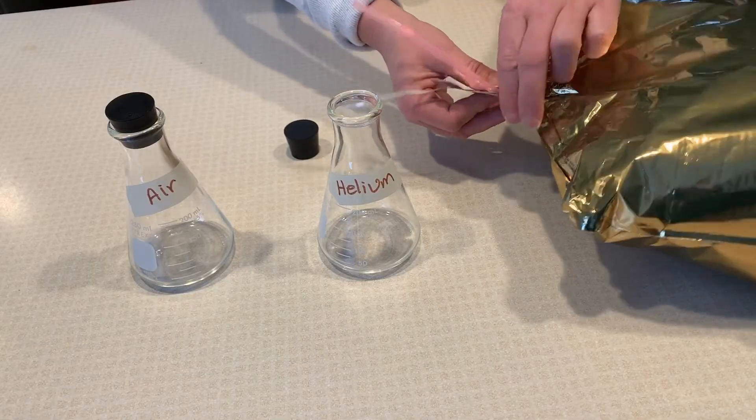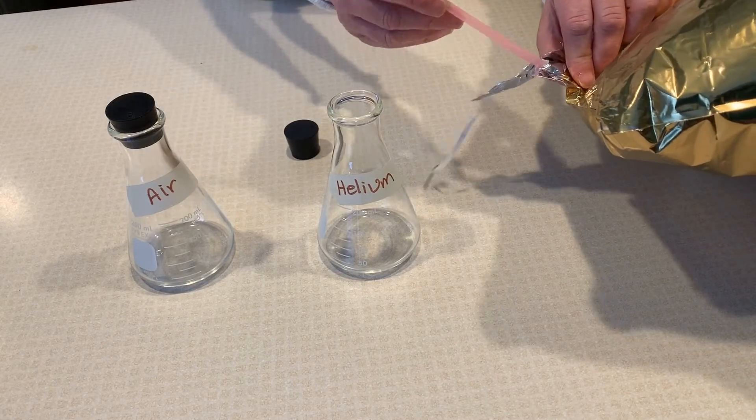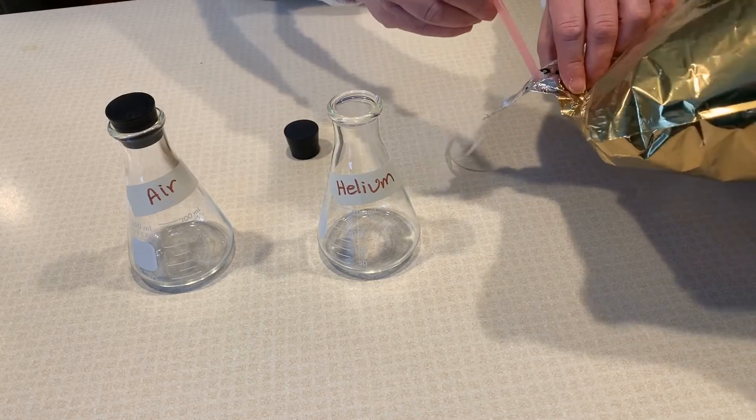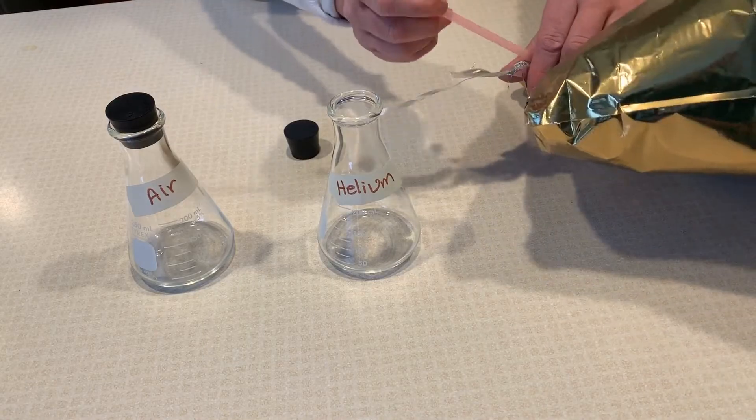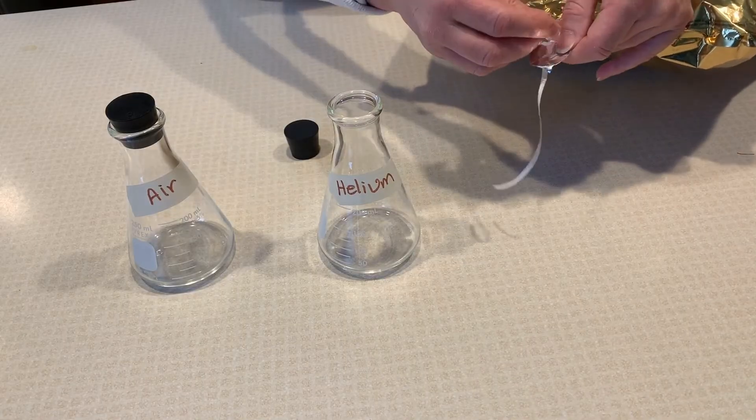In order to get the helium from inside the balloon to my flask, I'm going to use a straw. I'll put the straw in the bottom of the balloon and push it all the way in.